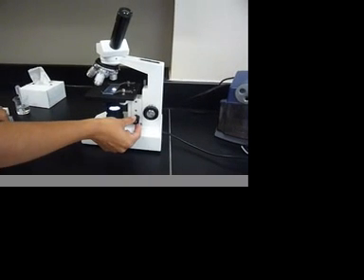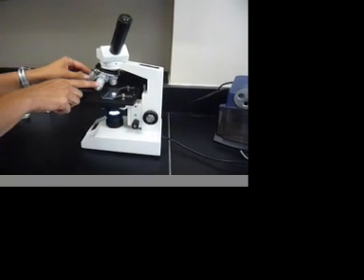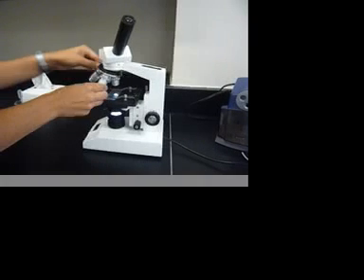After you find it in focus, then you can turn and use your higher power objective.